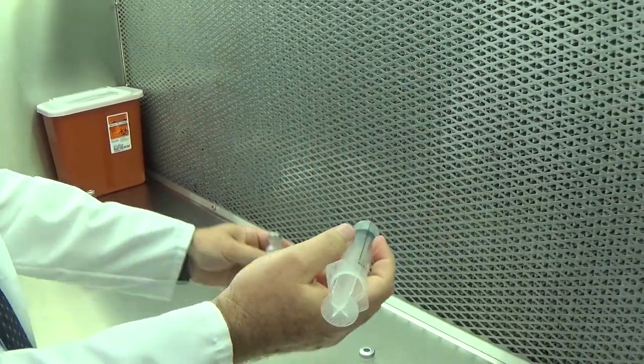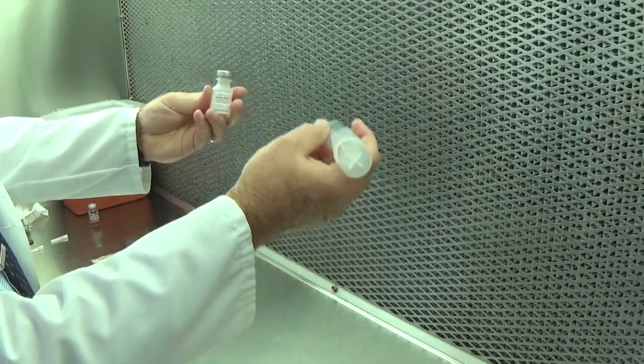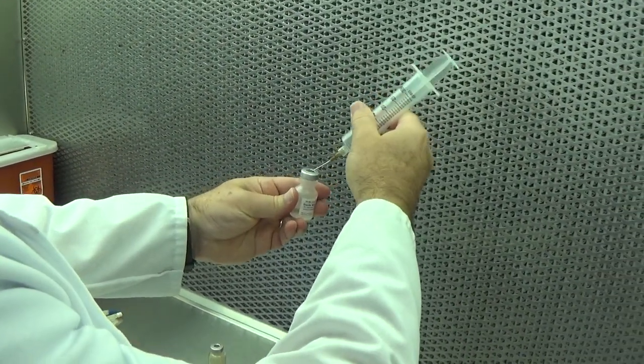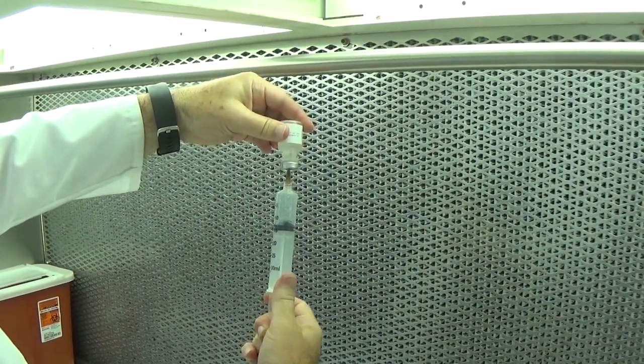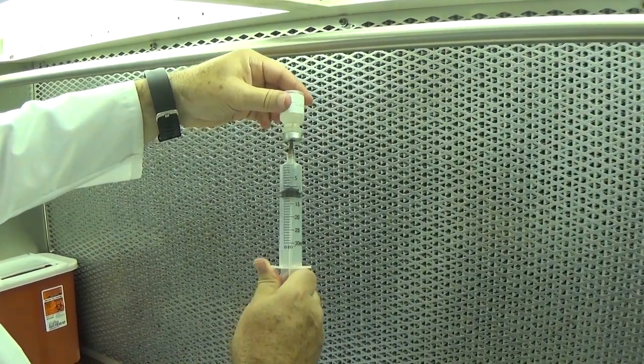And to reconstitute this powder, it's going to take 20 milliliters of sterile water. And the same technique applies. I generally pull, never pushing on the plunger.